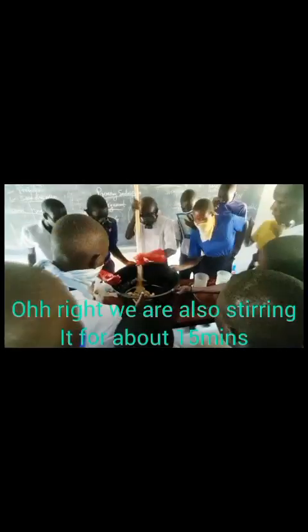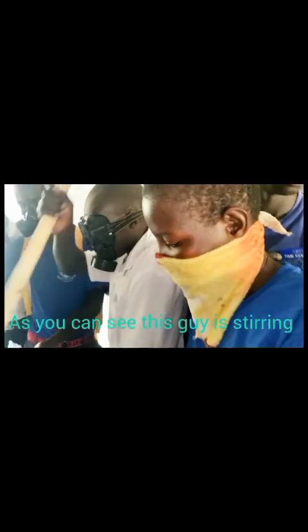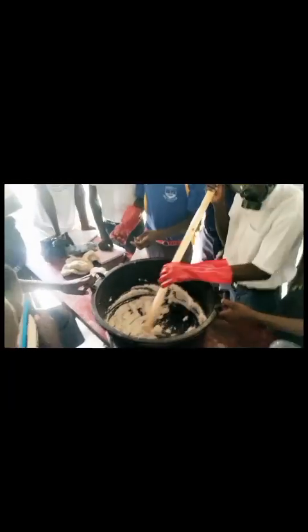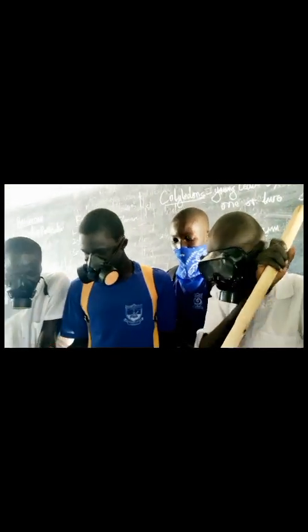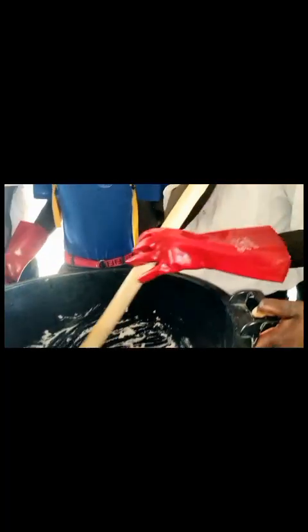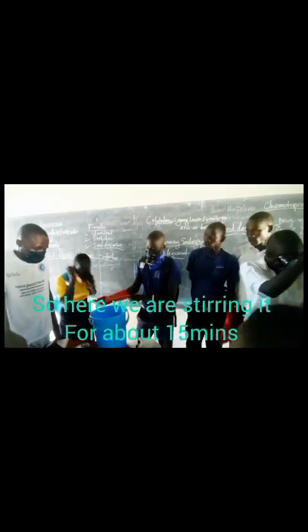Alright, so we are stirring it also for about 15 minutes. As you can see, this guy is stirring. It has a sharp smell. That's why all the members are covering their nose and mouth. So here we are stirring it for about 15 minutes.